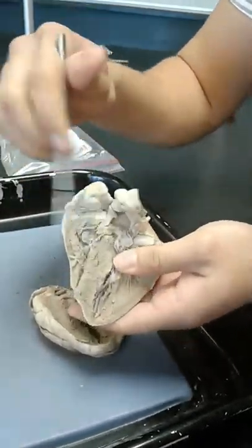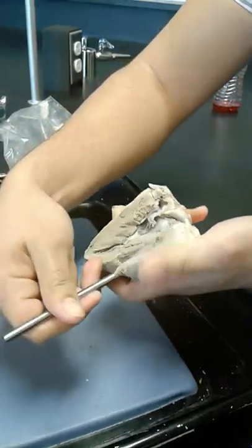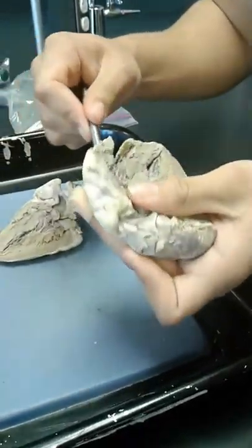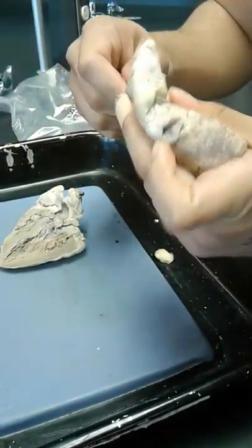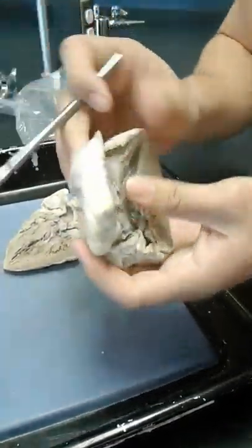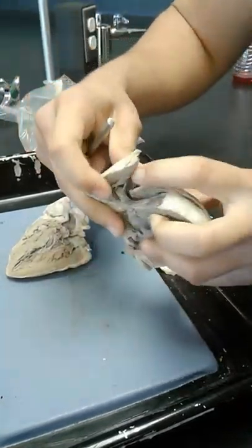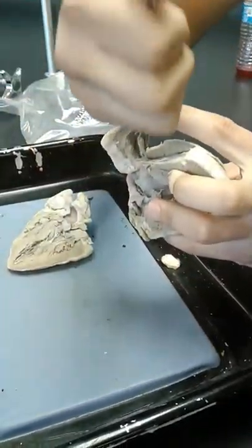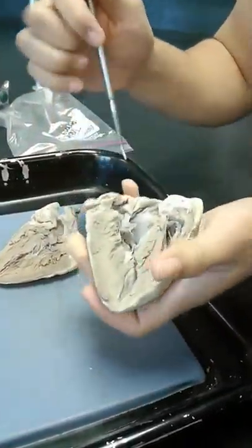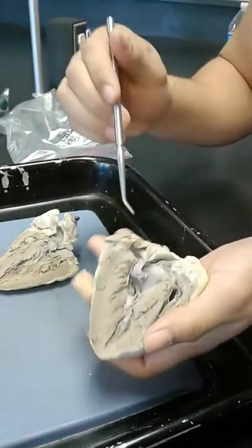From the right ventricle, it gets pumped through the pulmonary artery, which is right here. Now, there is a pulmonary valve inside here, which prevents the blood from going back into the right ventricle.